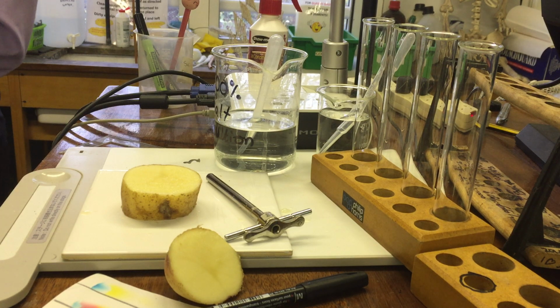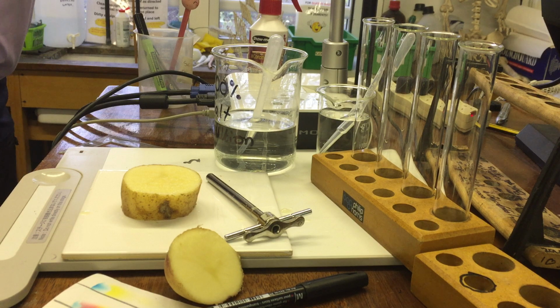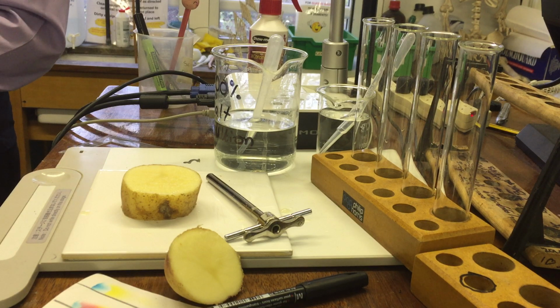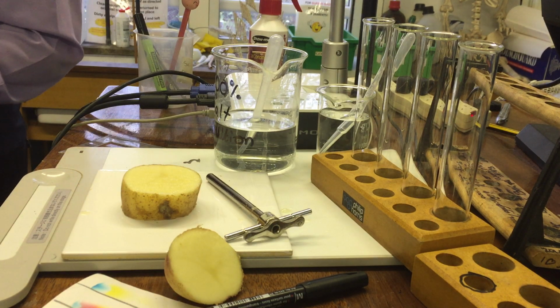What are going to be the controlled variables in the experiment? What things are we going to keep constant? We're going to try and keep that constant. We can't really keep it constant because we're not that precise. But we are going to try and keep not so much the weight, or the mass I should say, but the dimensions of the potato. How do you think we're going to keep the dimensions the same? So we're going to cut them to be 2 centimeters long.